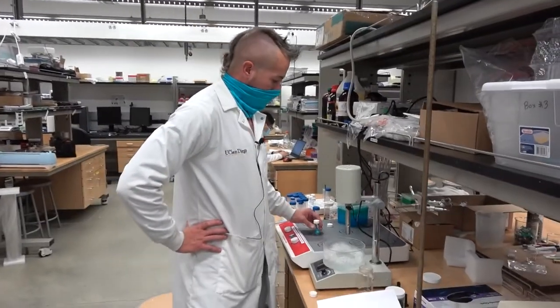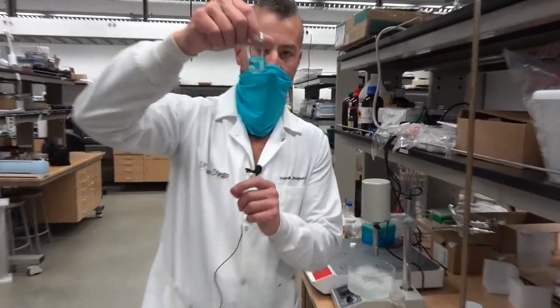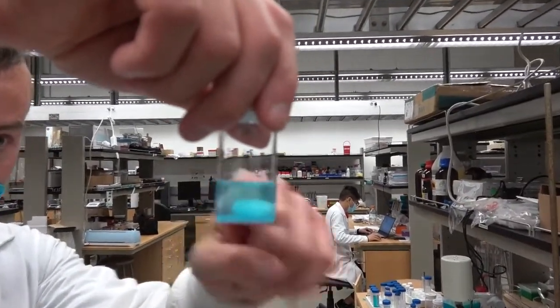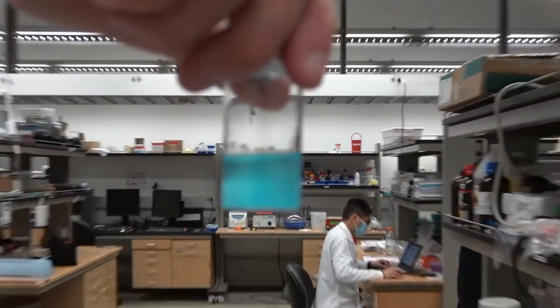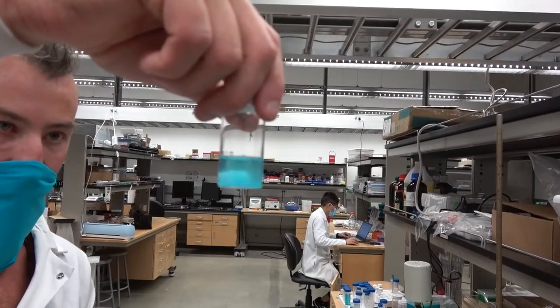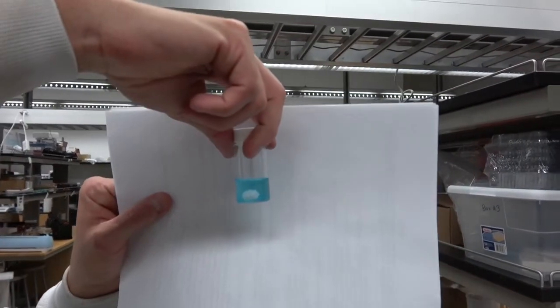Okay, so also coming back to our microparticles, one thing you can appreciate is indeed because of their larger size, see how they've kind of settled here? Notice how clear the supernatant is, and I'm going to stir it a little bit, and now you can see that the particles have resuspended, but because they're not nanoparticles, because they are microparticles, they are not colloidally stable, and so they tend to settle.